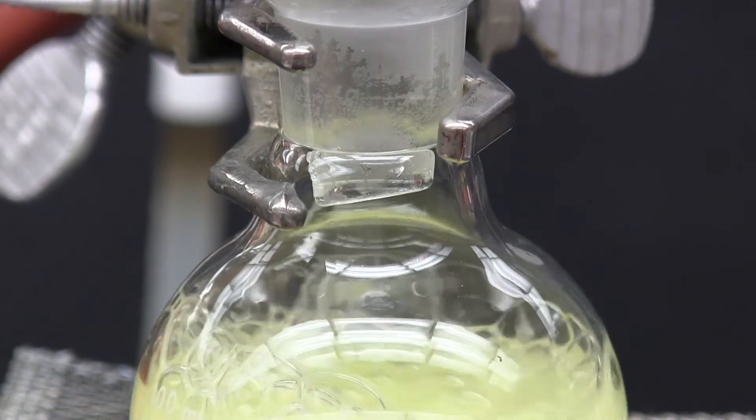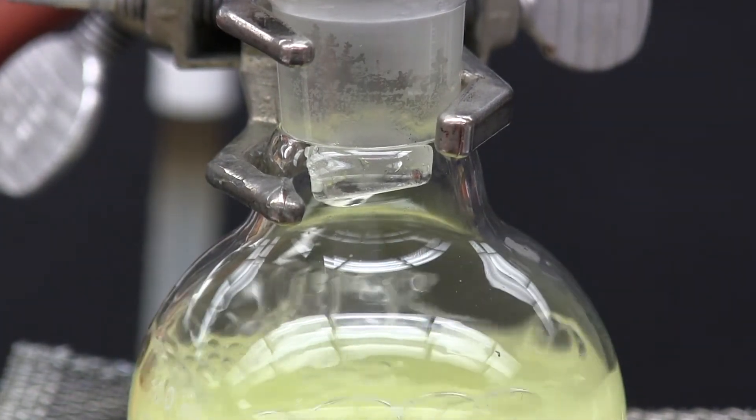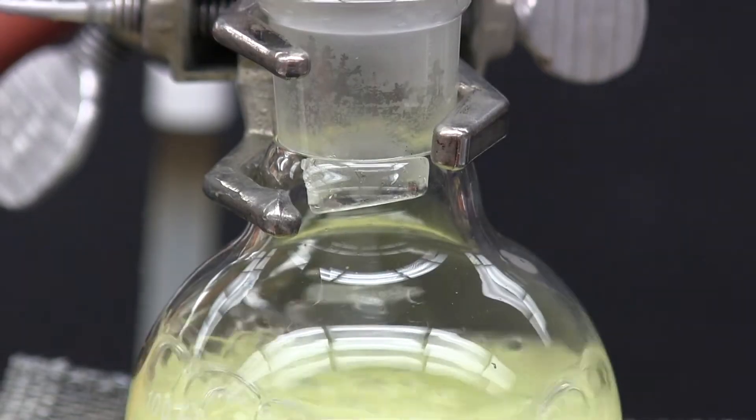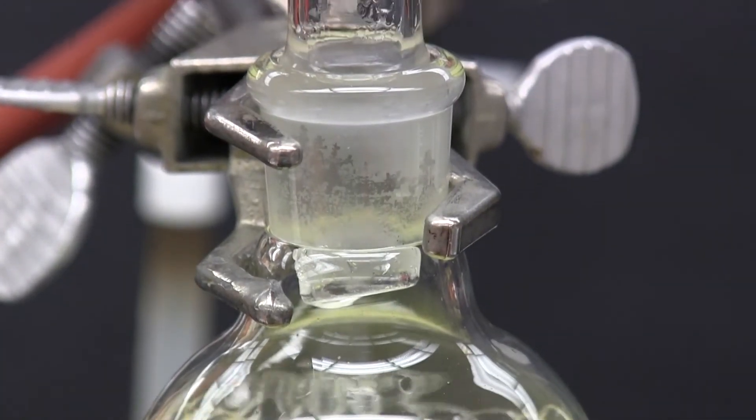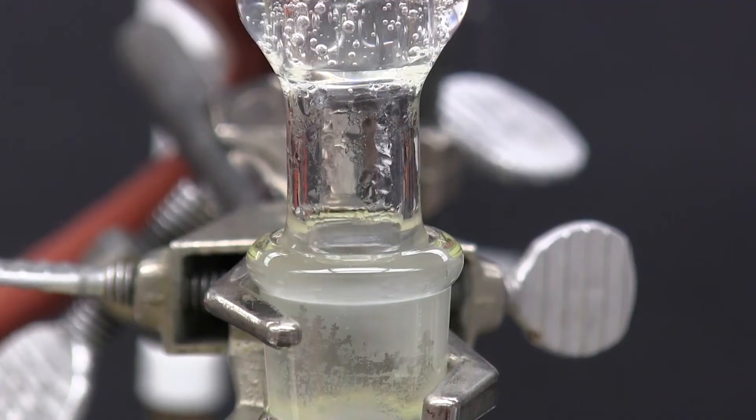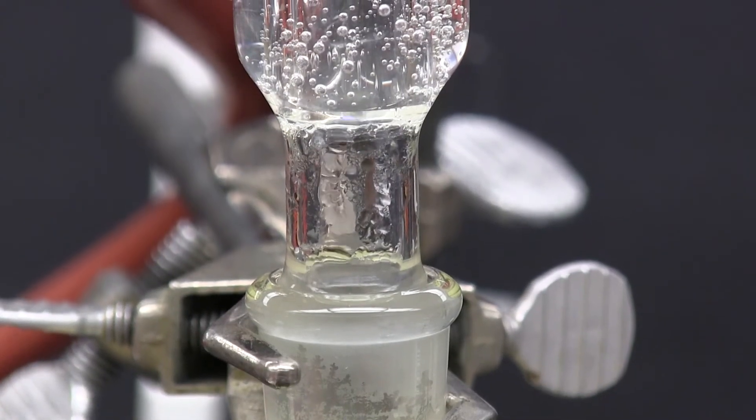Now looking closely we can see the solvent vapours on the inside of the condenser turn back into liquid, in other words condense, dropping back down into the continuously boiling reaction mixture.